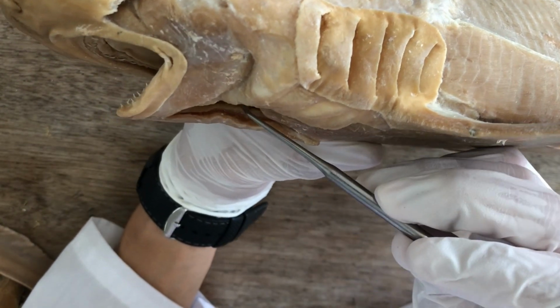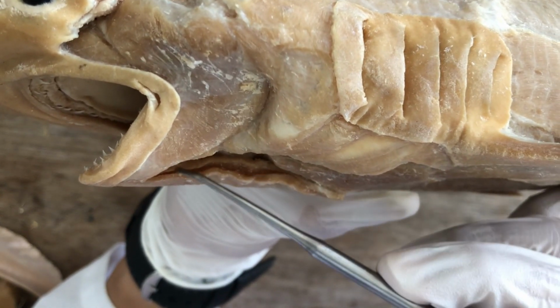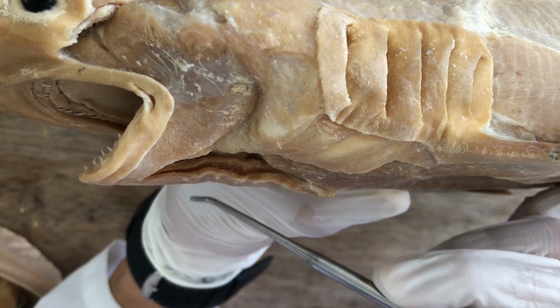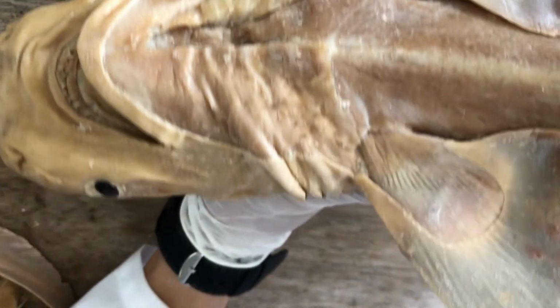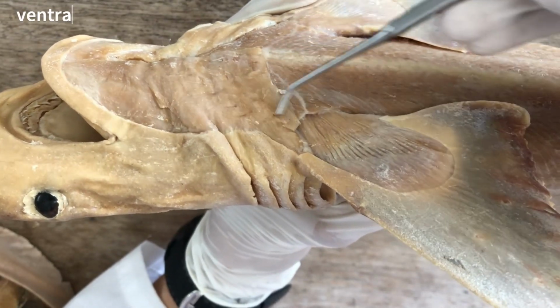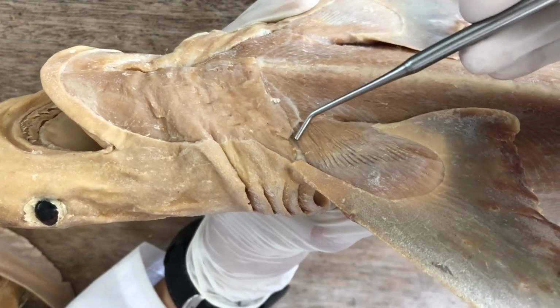Okay. And then the ventral constrictor muscle associated with the second arch is the interhyoideus, and it's located deep to the intermandibularis. So you can see two layers of muscles there. The superficial is intermandibularis. The deeper one is the interhyoideus. Right, and then the ventral branchial constrictors have no special names for the remaining gill arches, just ventral branchial constrictors.